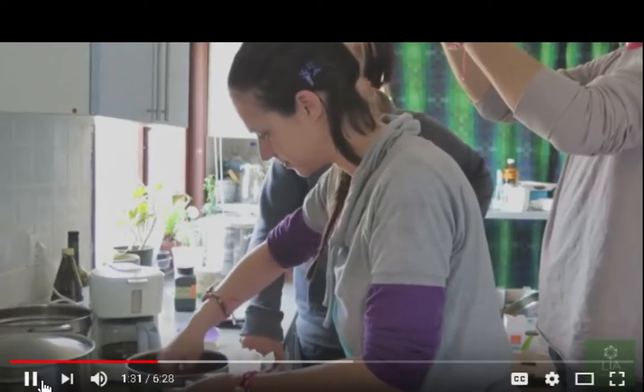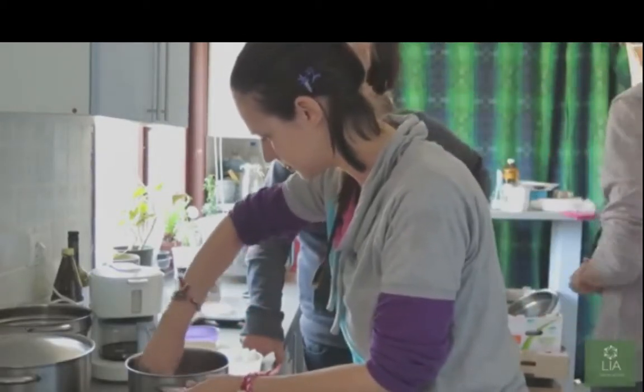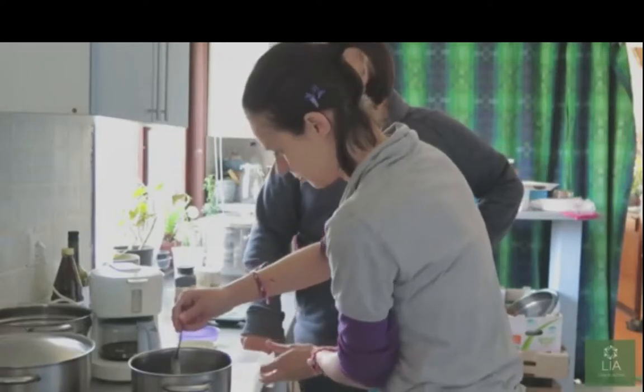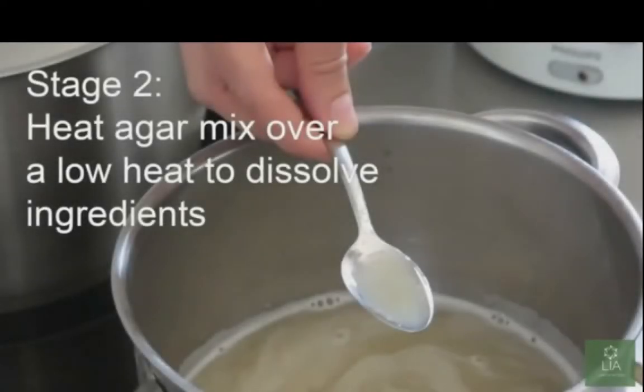They may just be using distilled water. So I believe she's stirring in agar, and I don't know what that is. I'm guessing.